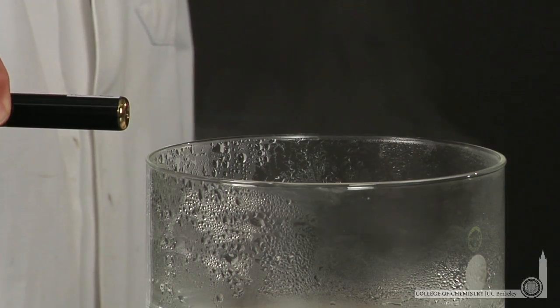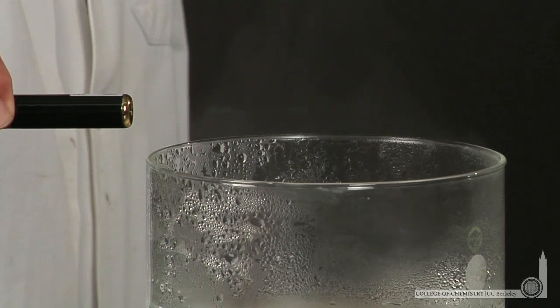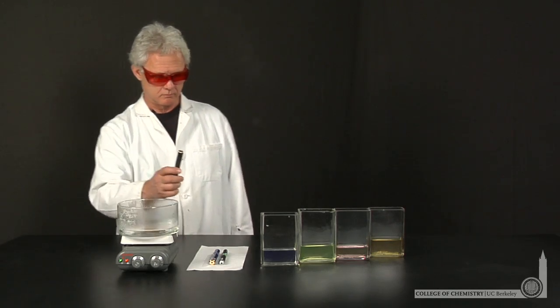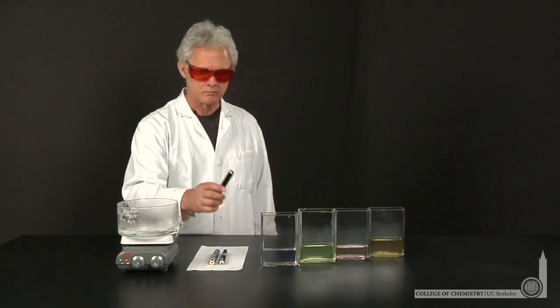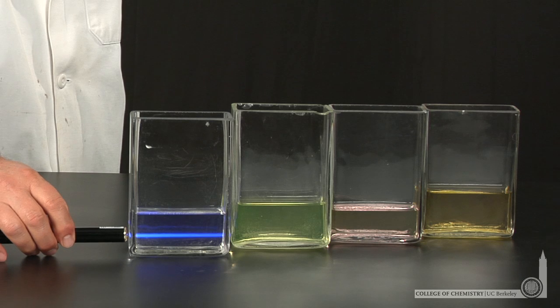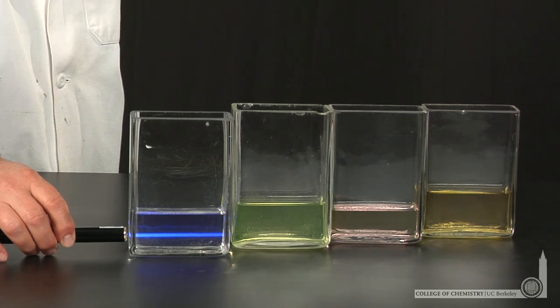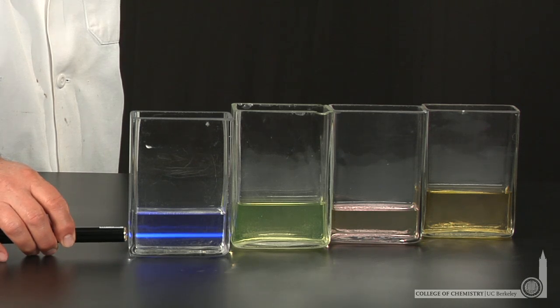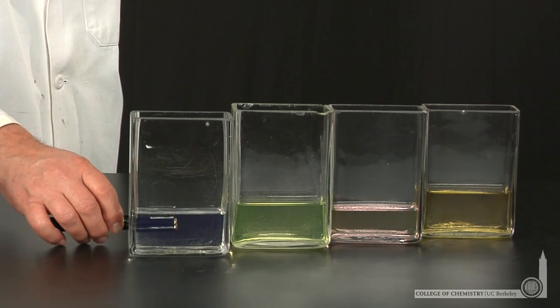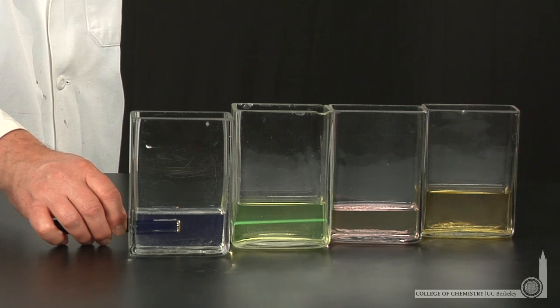Lonnie will start with an ultraviolet laser that's higher energy than the visible region. As the ultraviolet laser passes through this blue solution, ultraviolet photons are absorbed and blue photons are emitted.